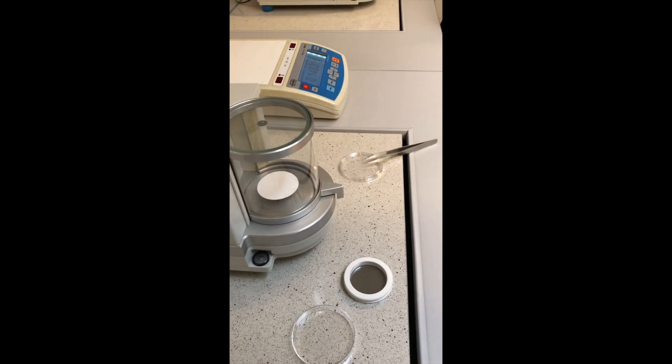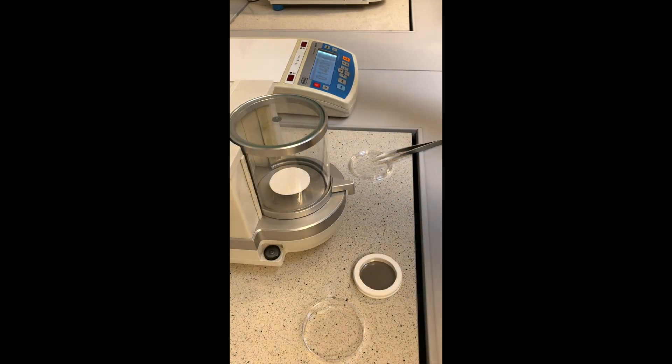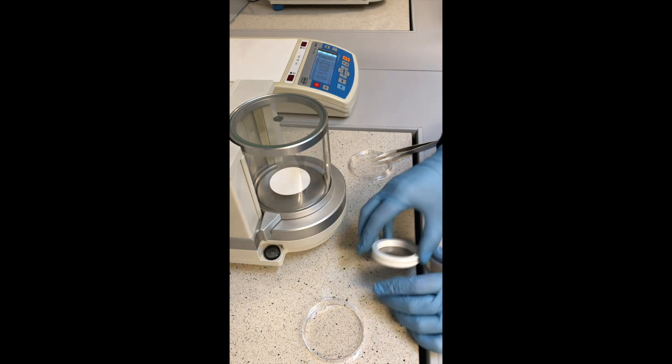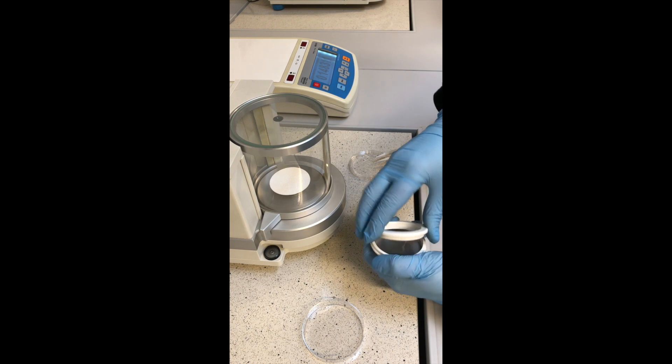To expose the filter, we don't put the filter into the sampler like this, but we use the holder. The holder looks like this. You have to open it and you put the filter into the holder.